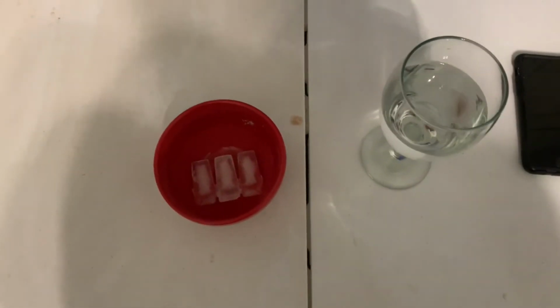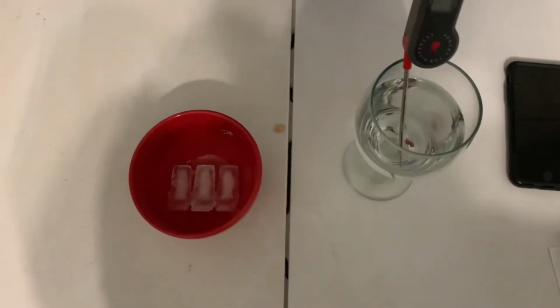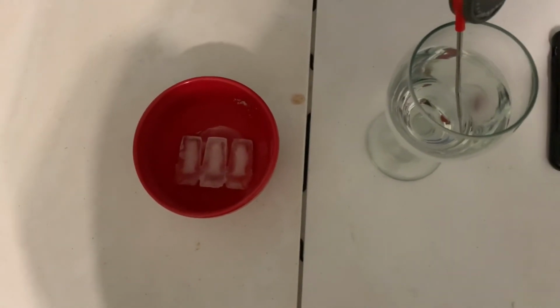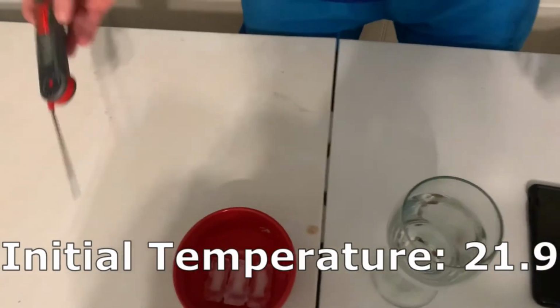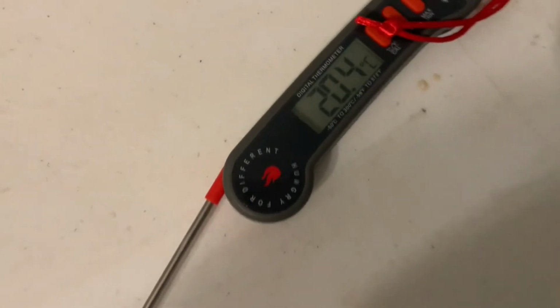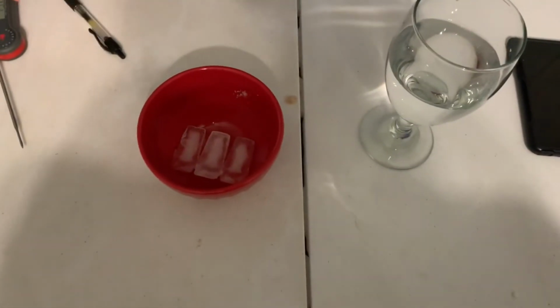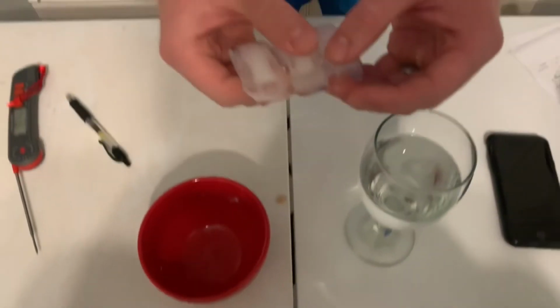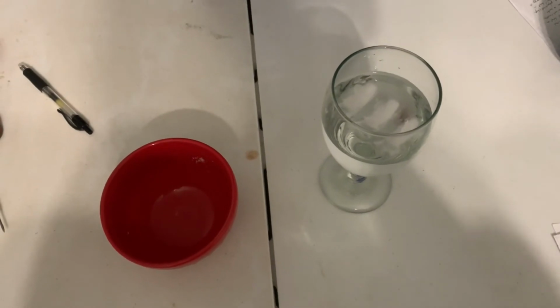So we're going to start as usual by taking our initial temperature reading. So I need to actually wipe this off. All right. So we'll take our initial temperature reading, which is 21.9 degrees Celsius. All right. Okay. And now we're going to take our 3 ice cubes and put them into our water. I'm going to set the timer for 2 minutes, and we're going to wait.